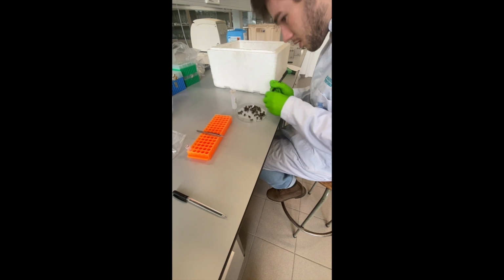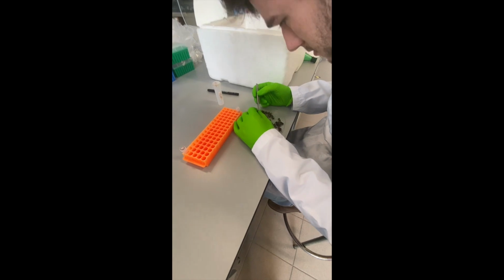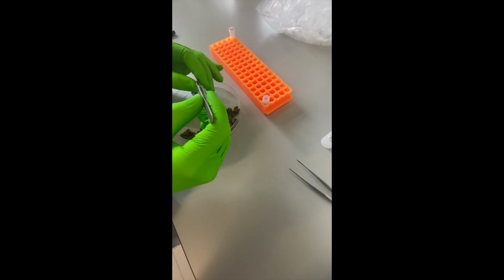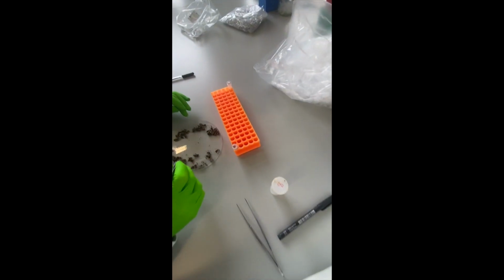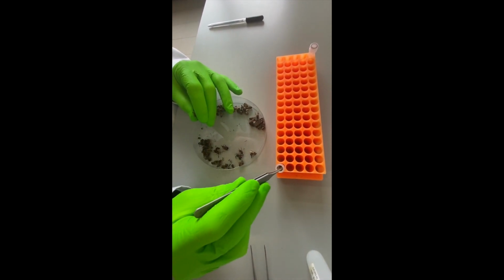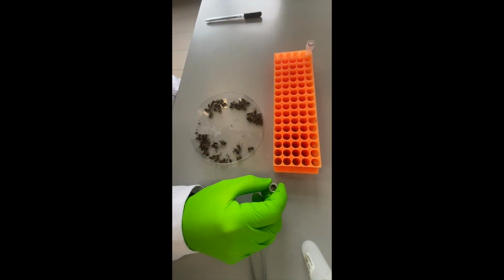Now we will show some hands-on videos in which we will demonstrate how to set up a TaqMan assay. First of all, you need to isolate DNA from the bees you want to genotype. In this particular case, we will genotype a pooled sample of worker bees. We will collect a leg from 30 different worker bees and collect them in a sample tube. Therefore, we use sterile forceps. So after collecting the 30 legs of the different bees, we close the sample tube.